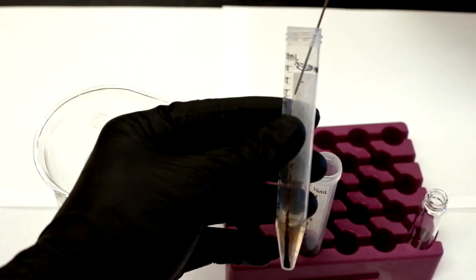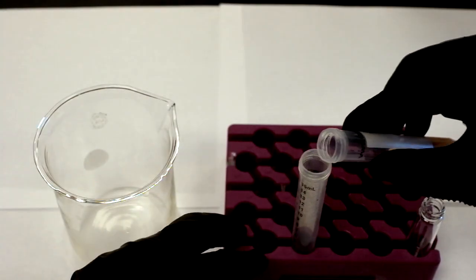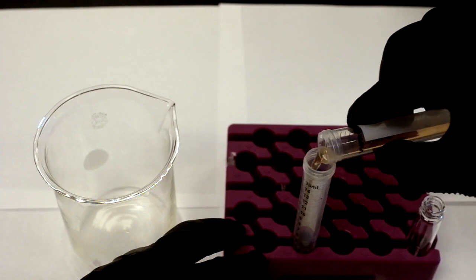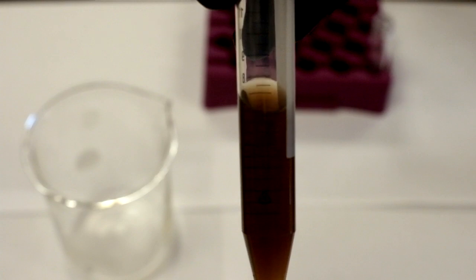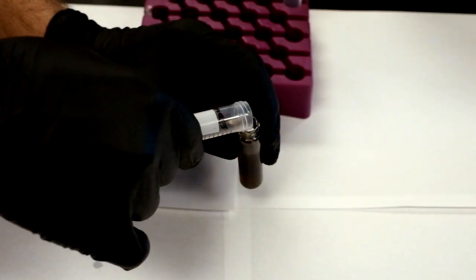We re-dissolve the crystals in about 7 ml of chloroform and thoroughly shake until all of it is dissolved. Use the same chloroform from the first tube to re-dissolve the crystals in the other tube. Once dissolved, the solution will be dark brown and clear if held up to the light. Store the solution in a glass vial at room temperature.